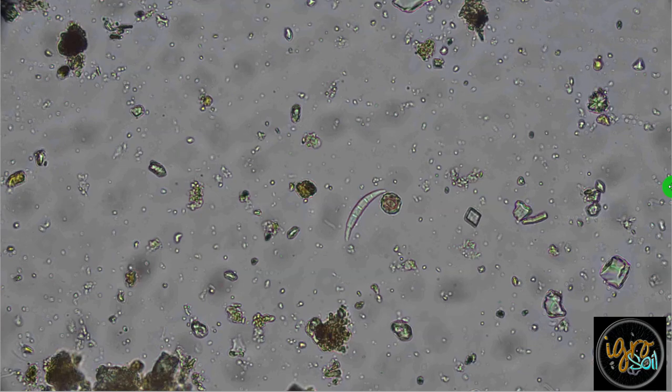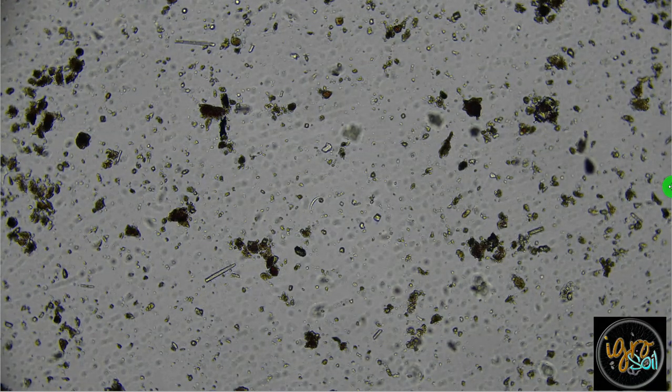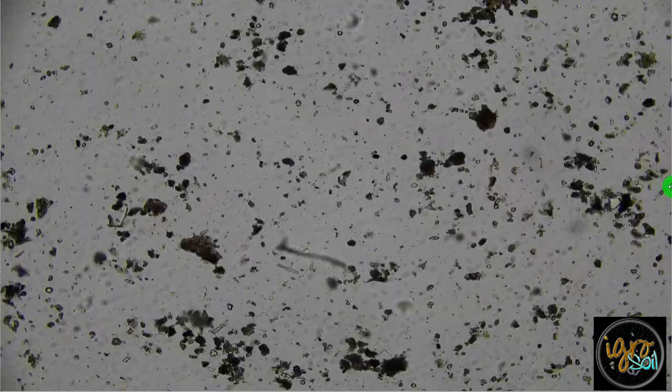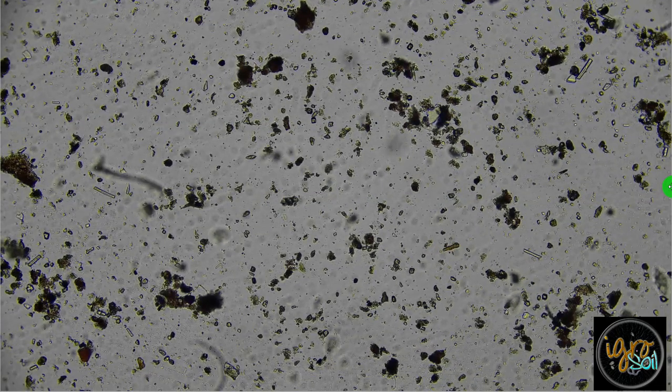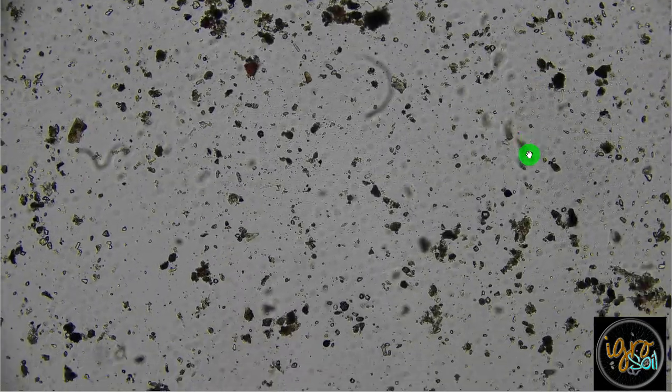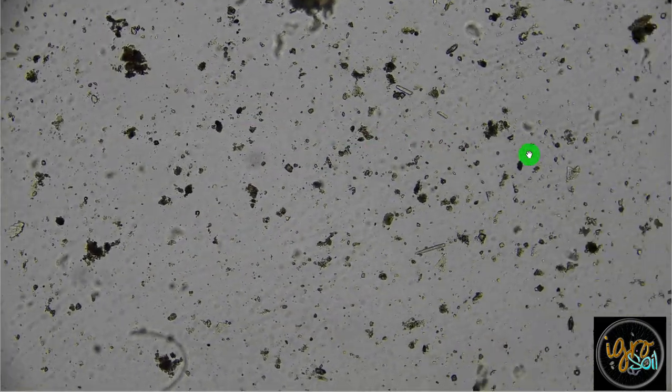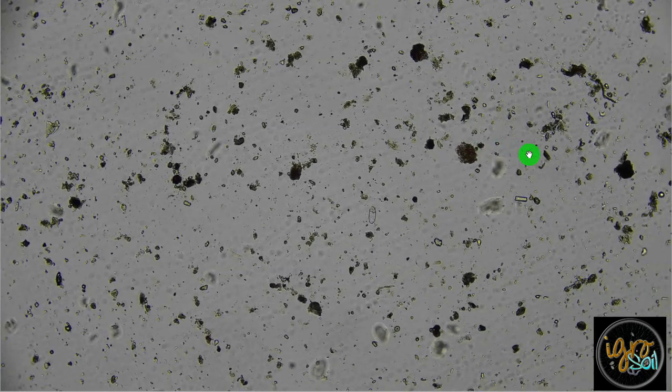I'm at 400x right now. I'm gonna jump back to 100, and you've got organic. This is only a 5-time dilution, by the way. So you do have organic matter. All this stuff you're seeing, all these darker, lighter, that's all good stuff. I mean, other than that, you're probably under 0.5% organic matter.